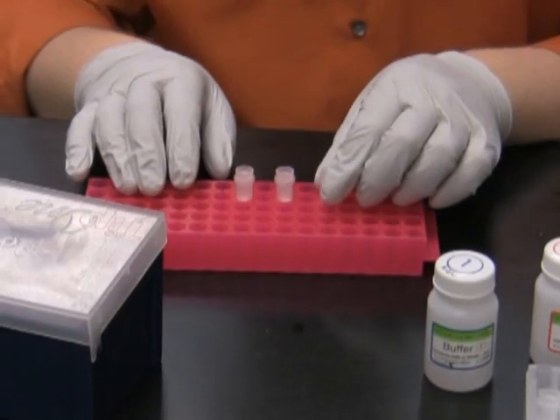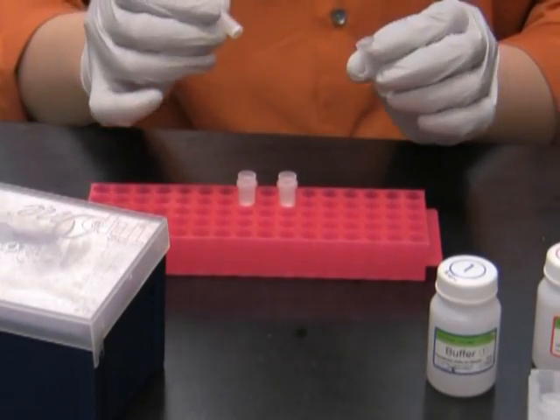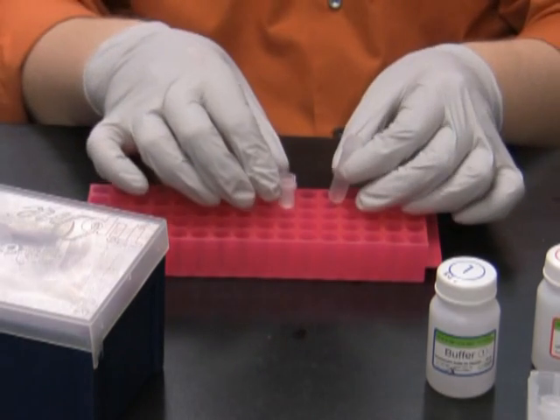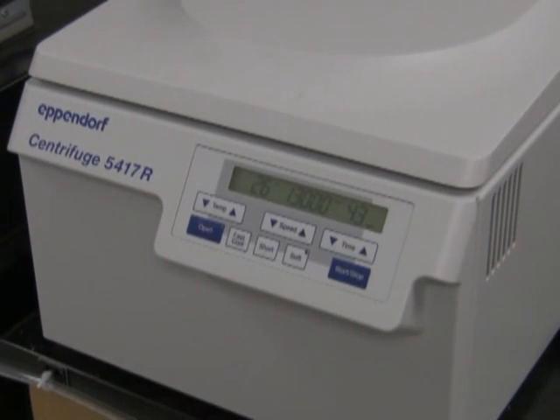Then I discard the ethanol and spin one more time to get rid of the leftovers of the ethanol.